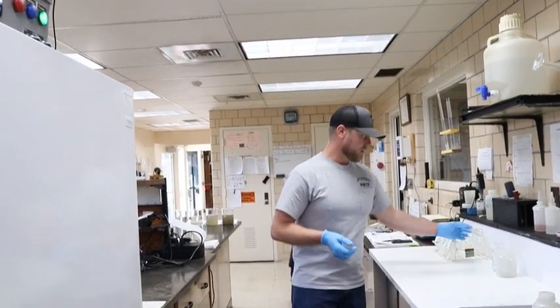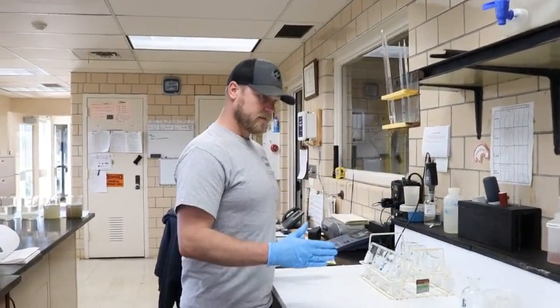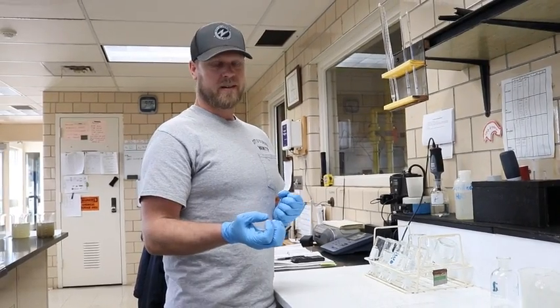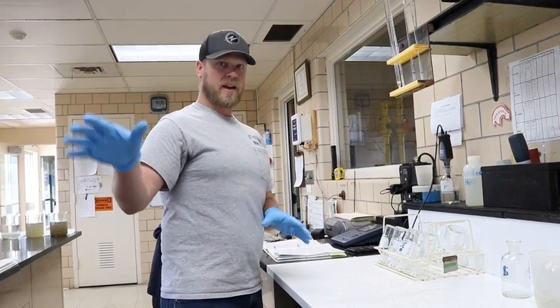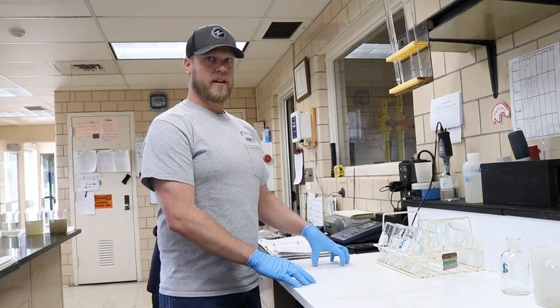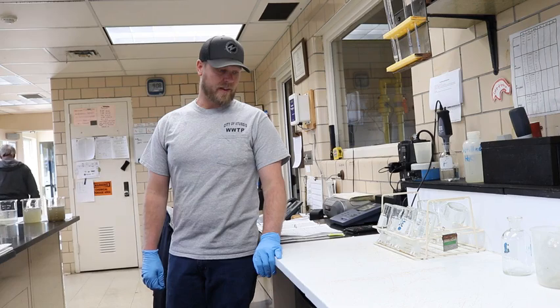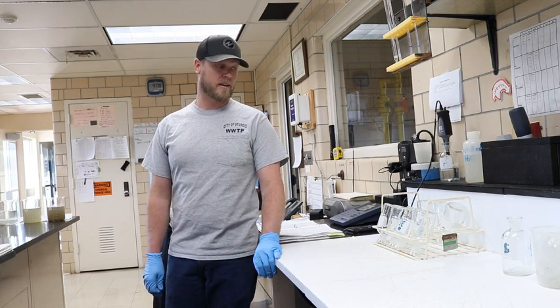So what we're measuring is the dissolved oxygen in the water itself. And we do this for every process throughout our plant. We take an initial dissolved oxygen reading, record it on our bench sheet, and incubate it for 5 days at 20 degrees. We remove them, and we measure that bottle again to see what residual dissolved oxygen is in that bottle. A lot of math, a lot of precise measuring, and making sure that things are done in a sanitary way. That's what we're trying to do here, to make sure that we keep the river clean and what we put out there is treated the best that we can.